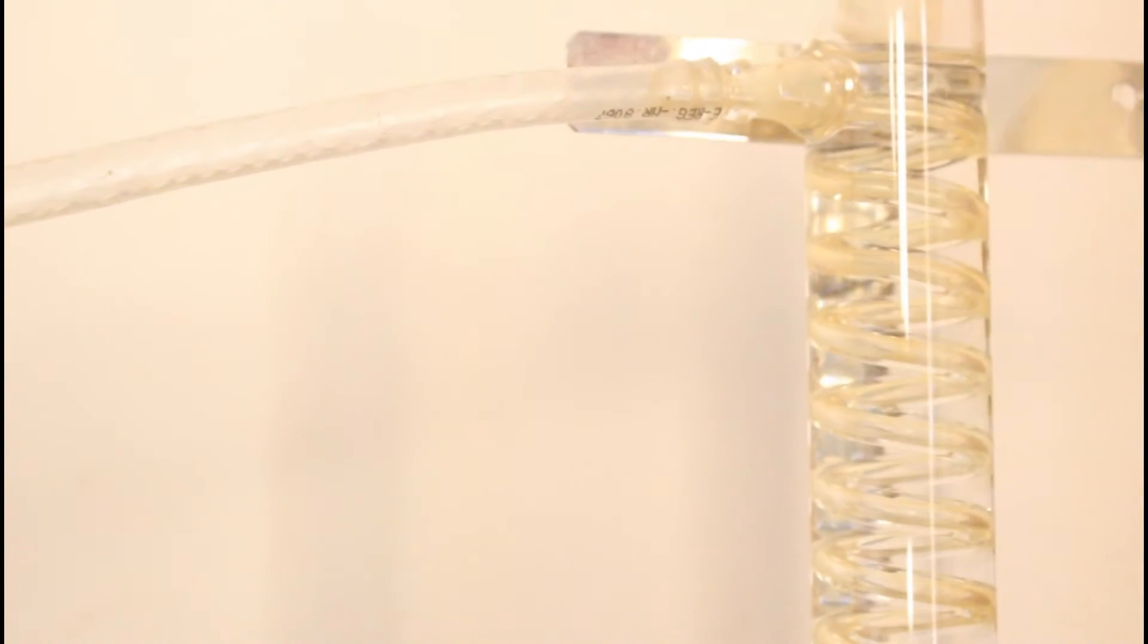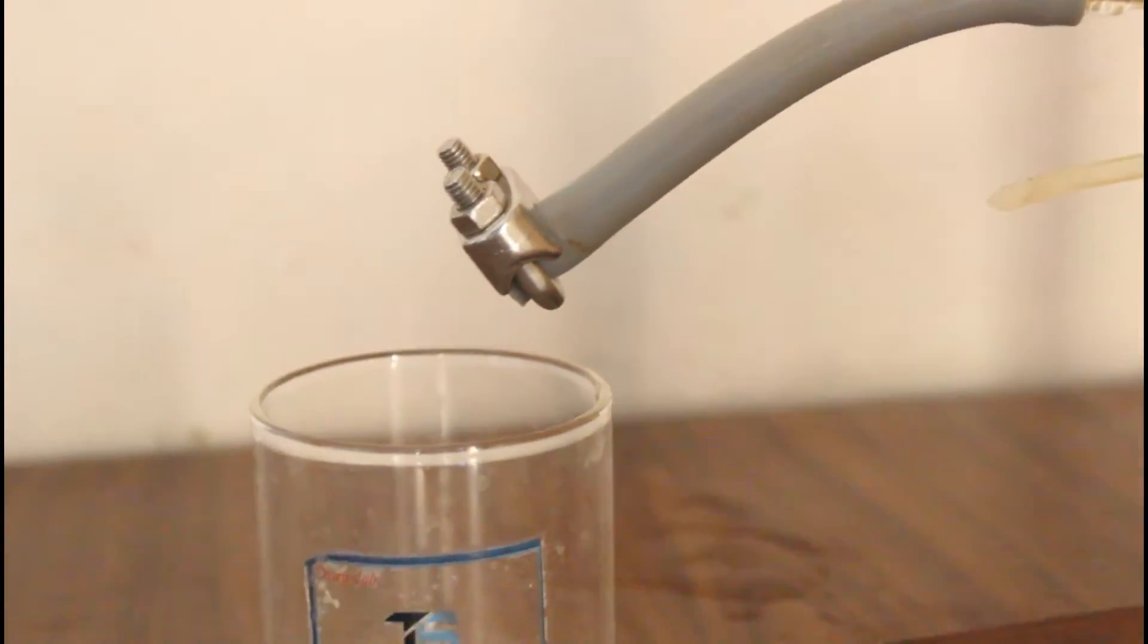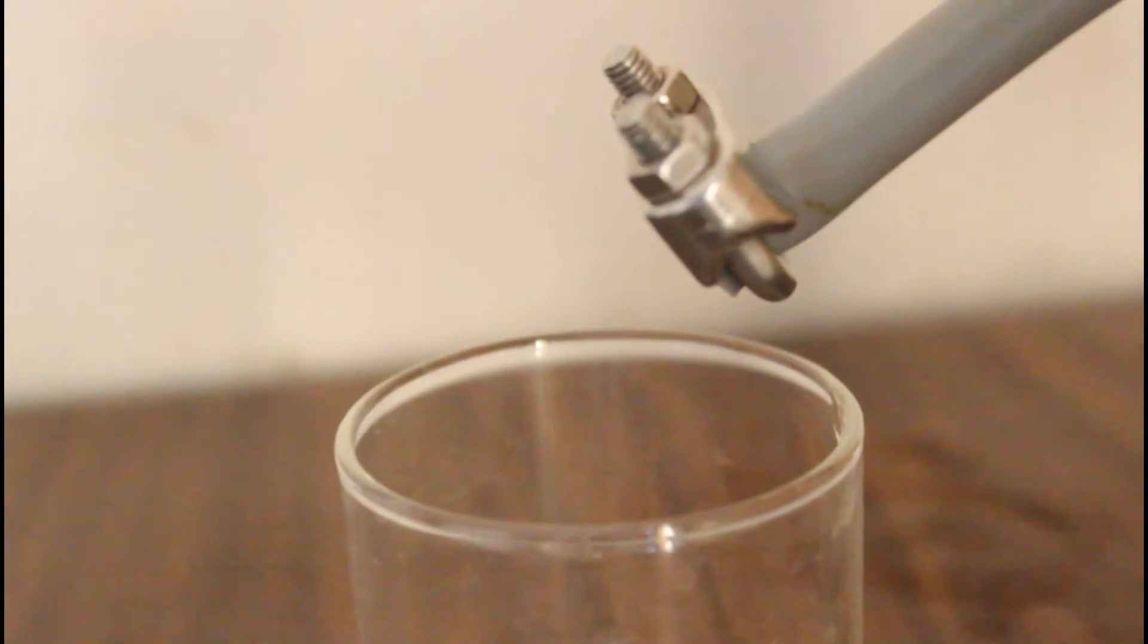The temperature we are getting with this heating plate is around 95 to 100 degree Celsius. But still you can see the liquid drops forming on the surface and also on this pipe. The liquid condenses and returns back to this vessel, hence we will never get a product.